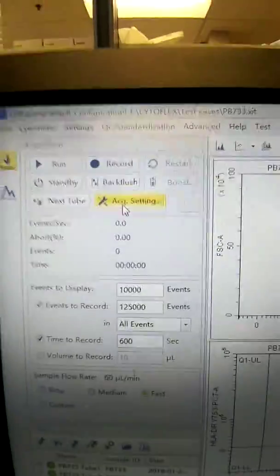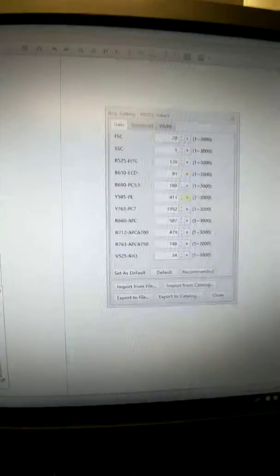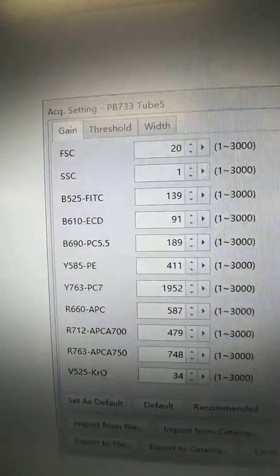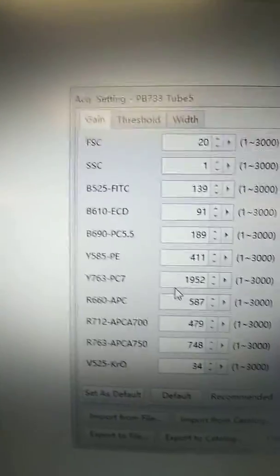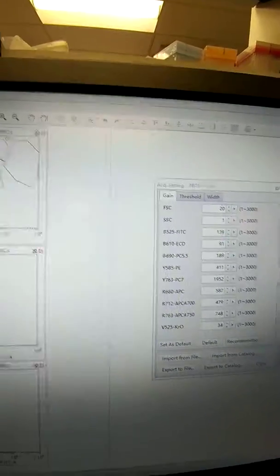I'm going to open the acquisition setting menu. So over here, I'm going to take that sample tube 4 and rerun it. And you can either use the hand to bring that gain down, or you could manually type it in here if you want. So I'm going to hit run, and then we're going to just use the little hand tool. Okay, but you can see here how it starts the values, and we're going to be adjusting this YPC7, and you see that's at 1,952, which is quite high. So let's see if we can change that some.